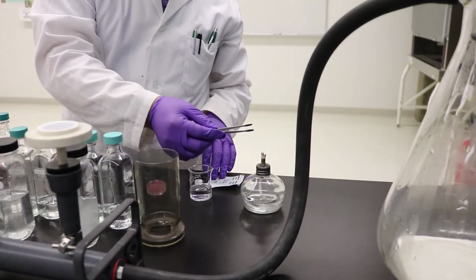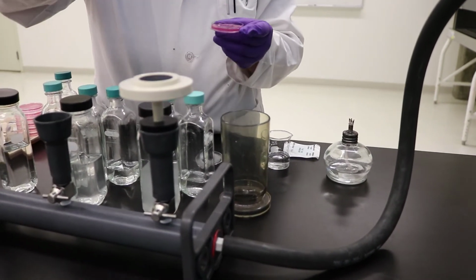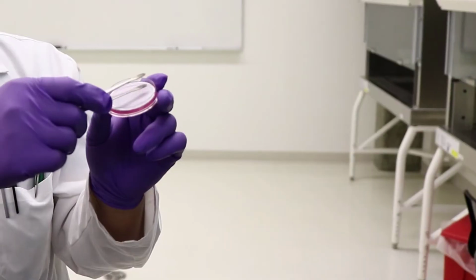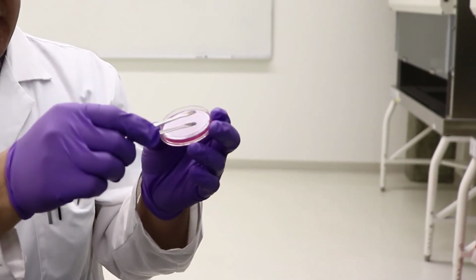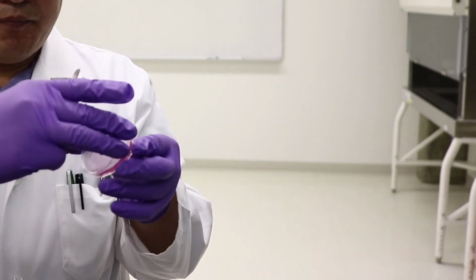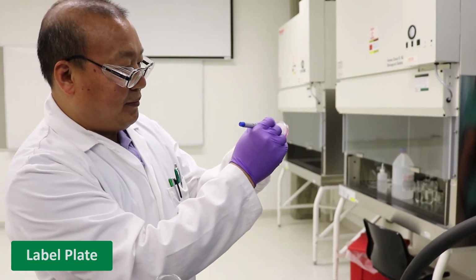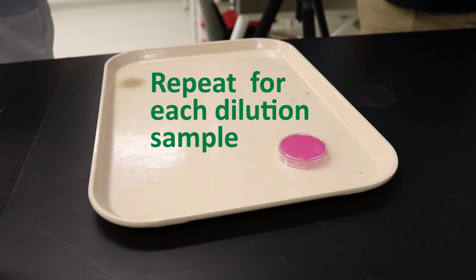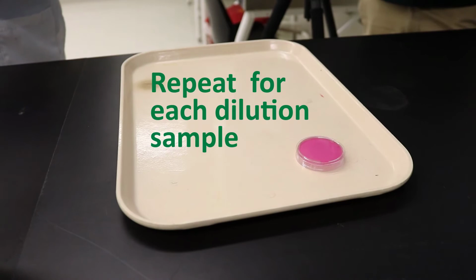Sterilize the forceps once again and use it to take the filter membrane from the filter unit. Place it carefully on the agar plate, grid side facing up. Carefully use the forceps to press the membrane into place in the dish to make sure the whole membrane touches the agar with no gap in between. Label a plate with the sample name, dilution, and group ID on the bottom. You will need to repeat this process and make 2 plates for each dilution sample that was previously created.